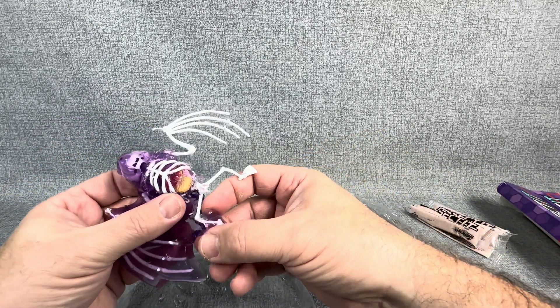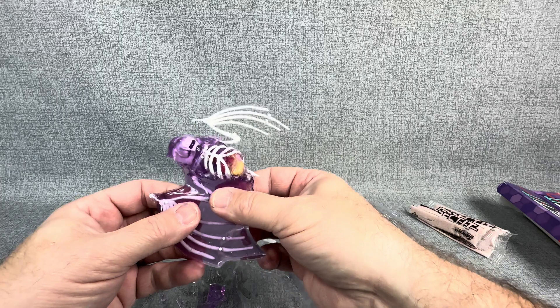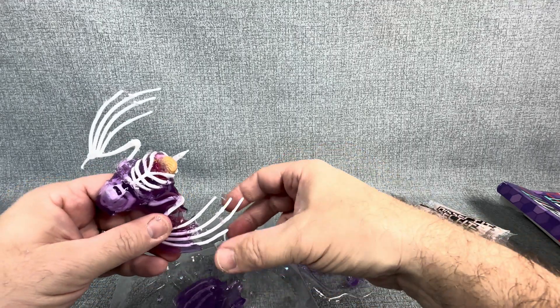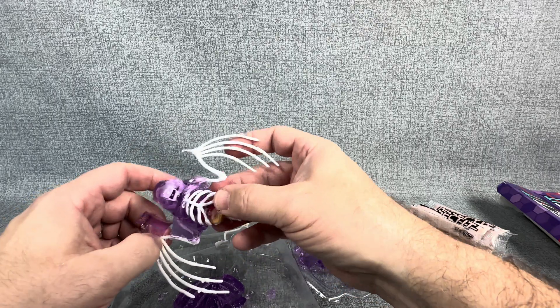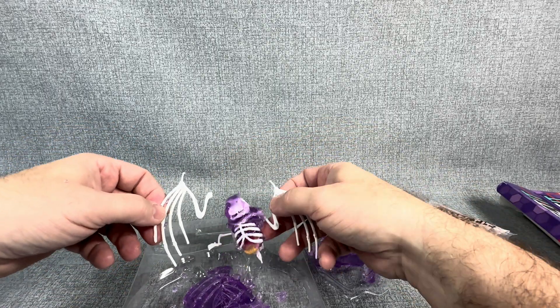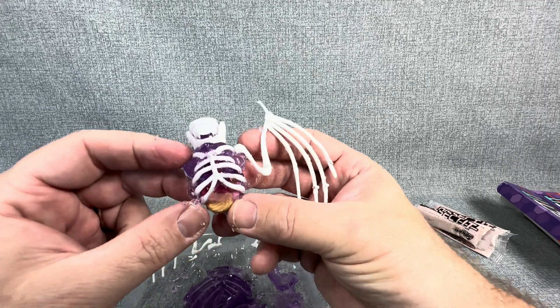We're going to take a look at the skeleton itself and what comes in. I just actually removed the legs and the hip — those are a solid piece. This is definitely something that would be fun and creepy for your kids around Halloween. It's kind of fun to get your hands all slimy and gel-covered. Just kind of filled with gel in there with all the internal organs, as you can see right there.